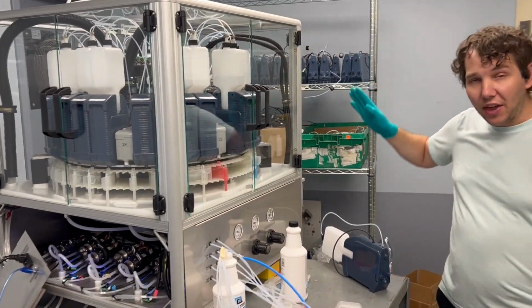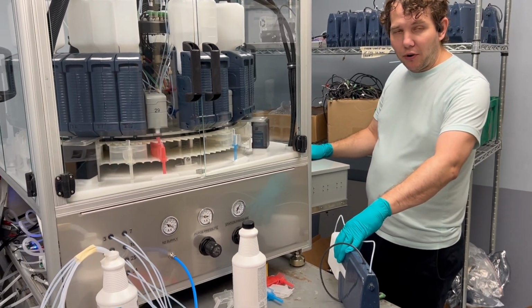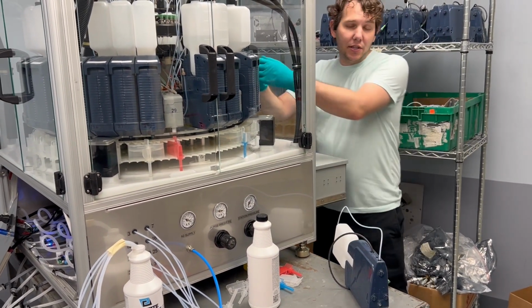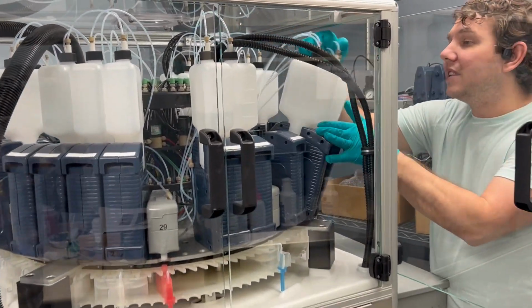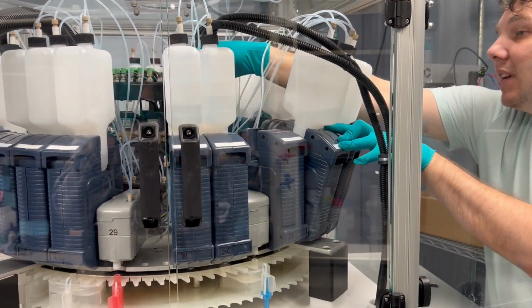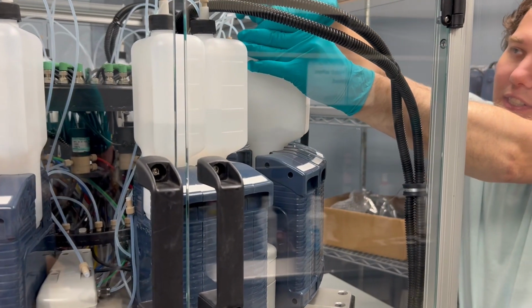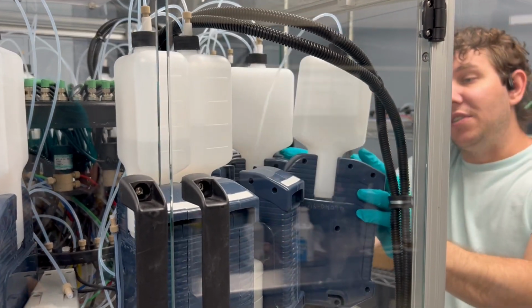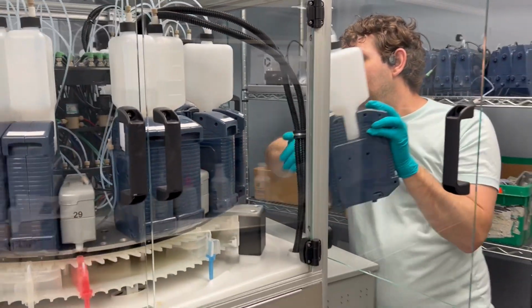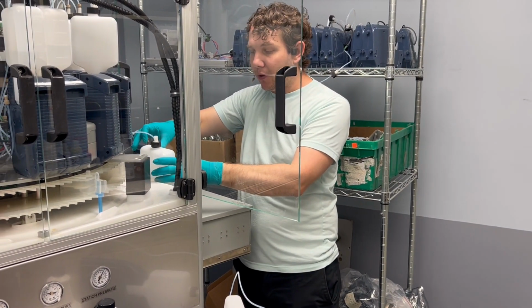So first, obviously make sure that the Tetras is paused so that it will not move while you're working on it. We have our spare station right here. The bottle's already on it, just so that the tubing's all contained. So what you do is you reach in here, unplug it from the comm ring, unscrew it from the nitrogen, and then you would remove the station. So the station is removed. Obviously you have to be careful with the bottle because it still has fluid in it.